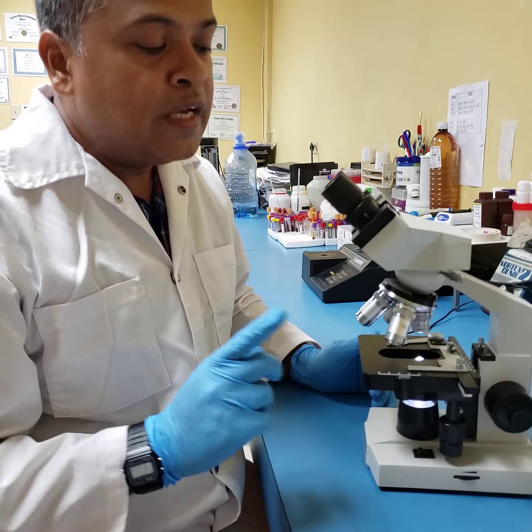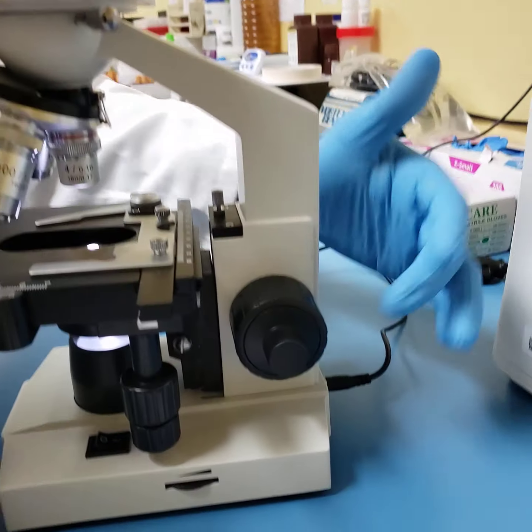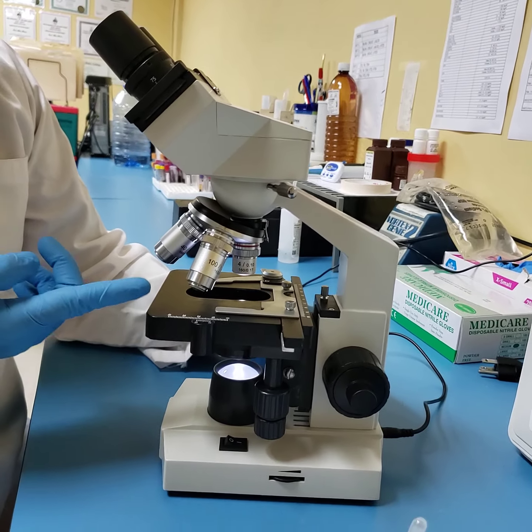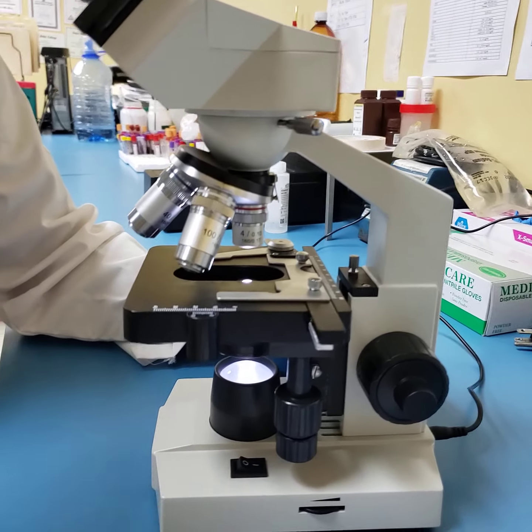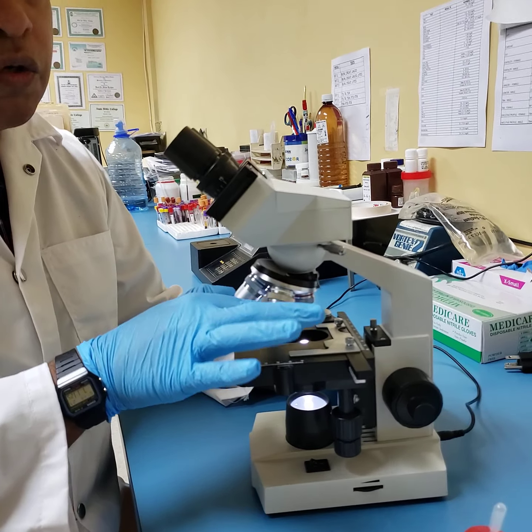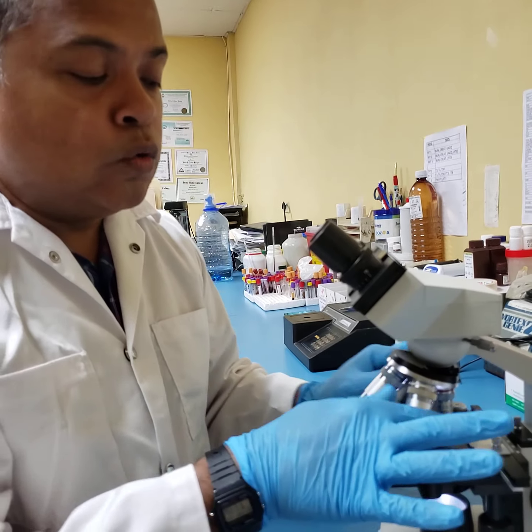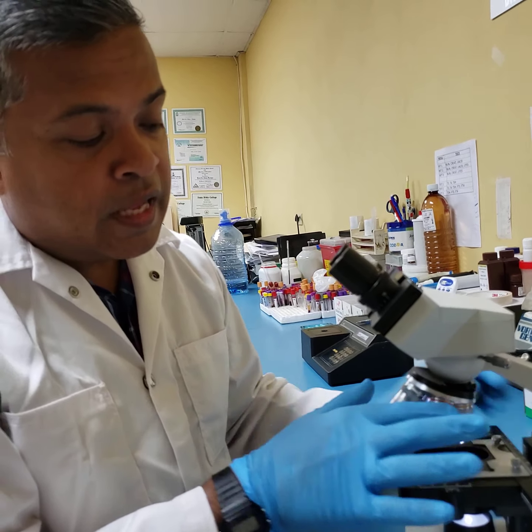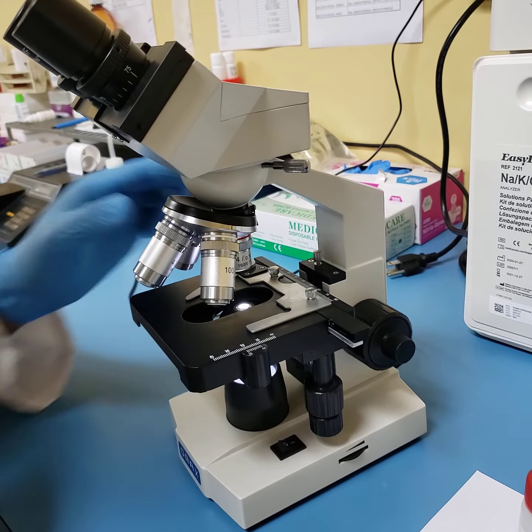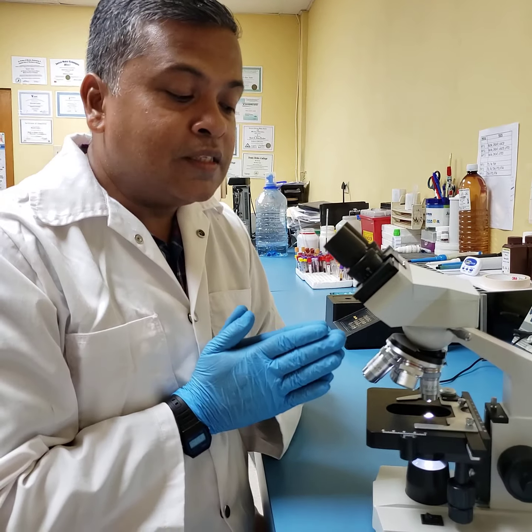Step three is you take your coarse adjustment knob, students, which is this one, and you turn it away from you. In doing that, your stage goes up. But simultaneously, and you can call it step number four, you also adjust your nose piece to bring your lowest power lens facing down. The nose piece is adjustable, and you will hear a little click when your different lenses are moved into place. All right, now let's just spend a minute or two to discuss these lenses.